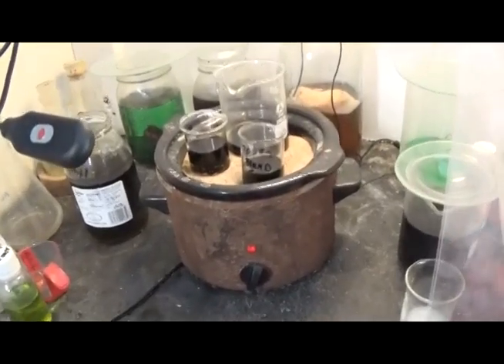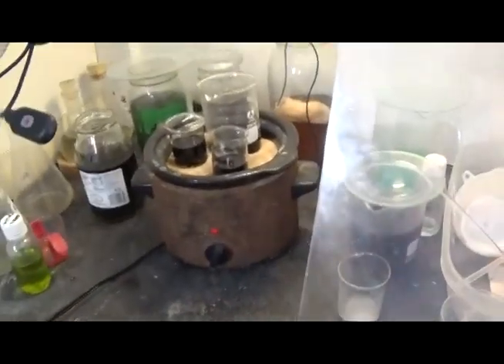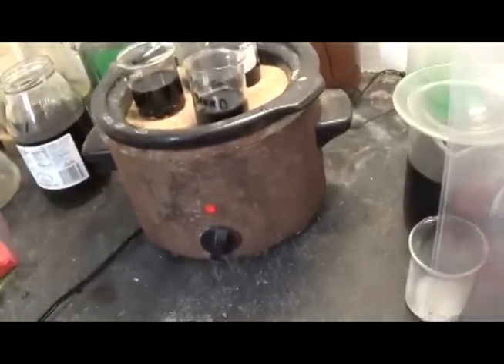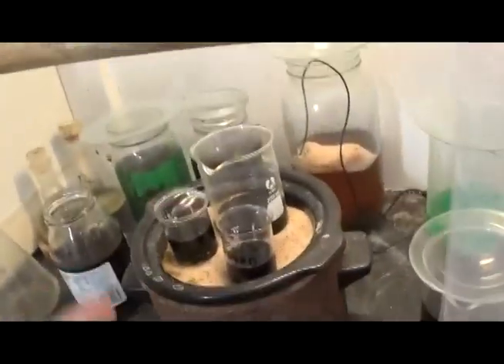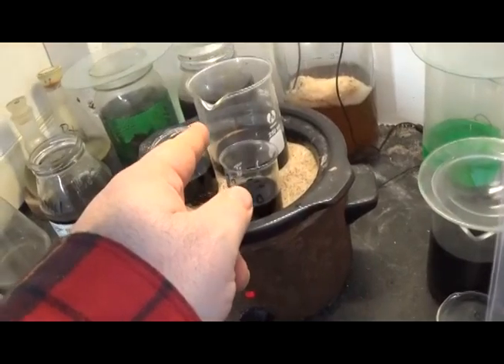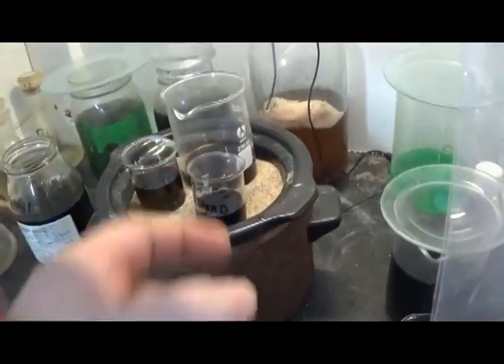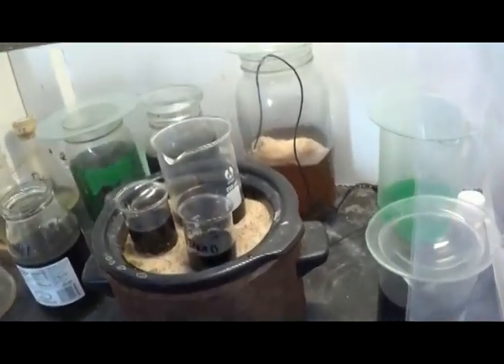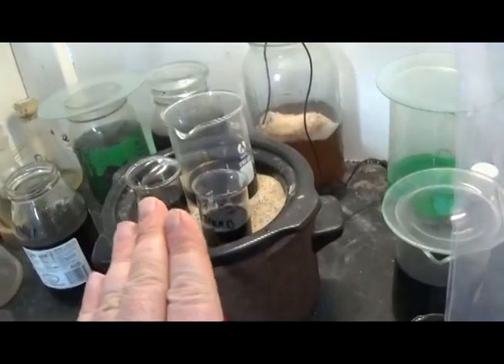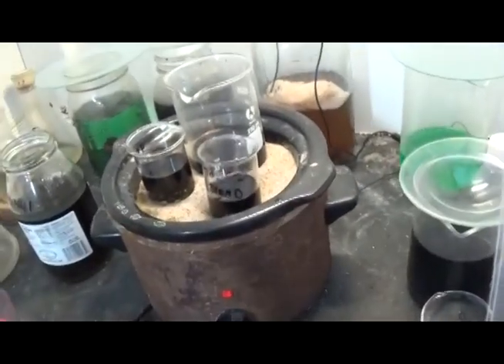We're into the second 24-hour period — about 9 o'clock in the morning, so we're 36.5 hours in. I put the half solution into a larger beaker so I'd have more surface area. I did examine one of the foils — one of the pieces of gold-fill material. Once the 48 hours ends, it comes off. We'll examine it and see what we got.